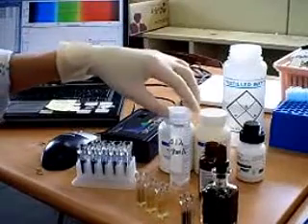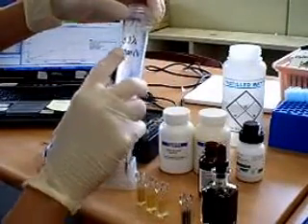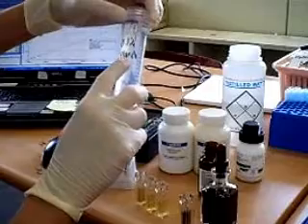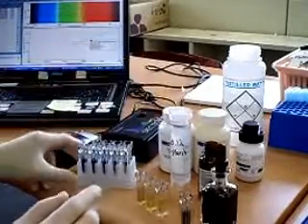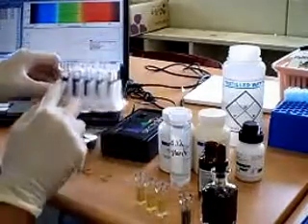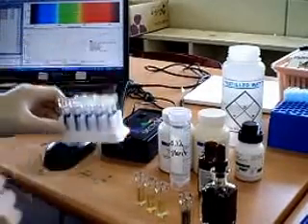Demonstrate a simple video tutorial. I'm going to quantify starch using a 0.1% starch solution. I prepared a 2-fold serial dilution of starch solution.